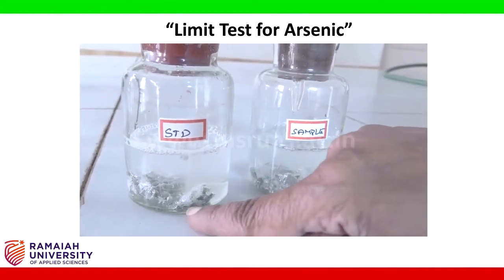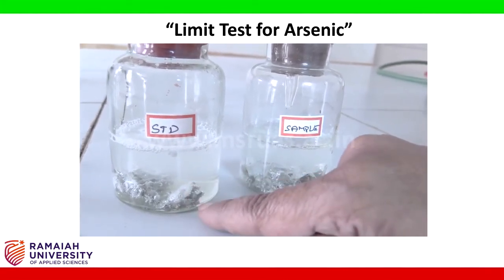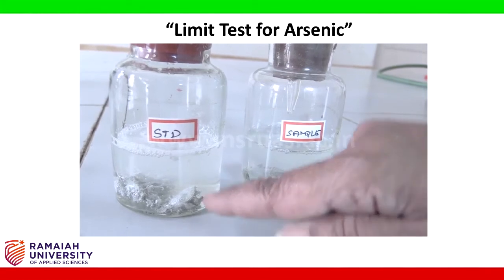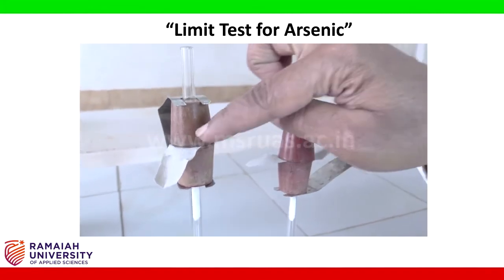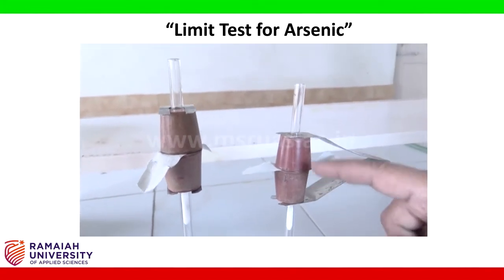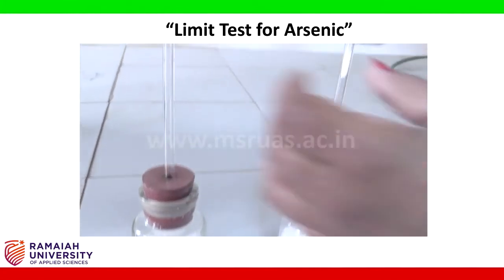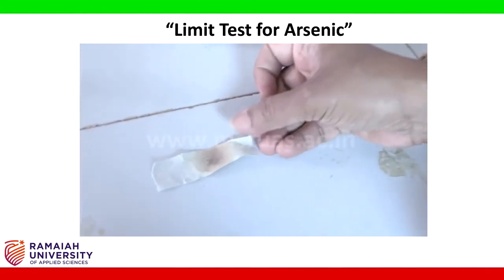You can see the evolution of hydrogen gas taking place, which is essential for converting the arsenic, if present, to an arsine gas, which passes through the capillary tube and stains the mercury chloride paper. The mercury chloride paper is compared for the stain in direct sunlight. After 45 minutes, check the mercury chloride paper for the stain.